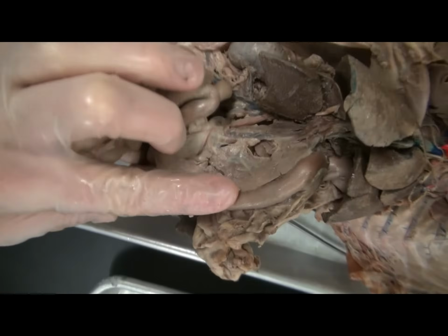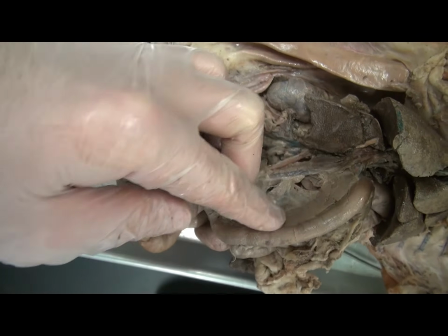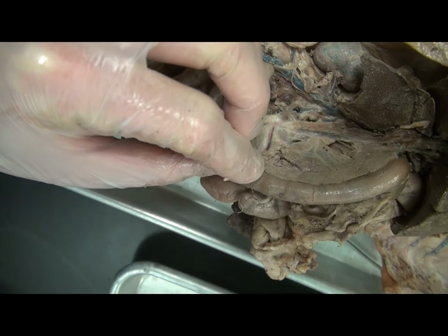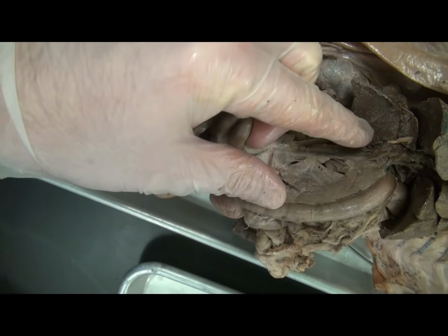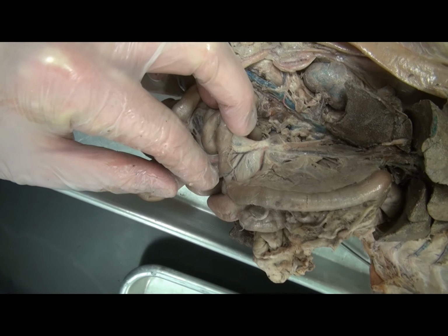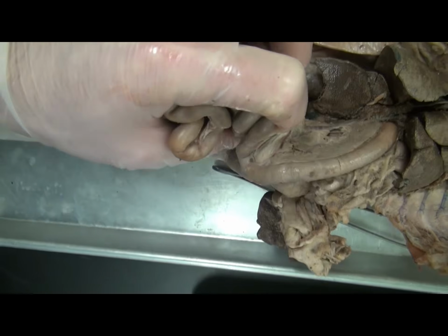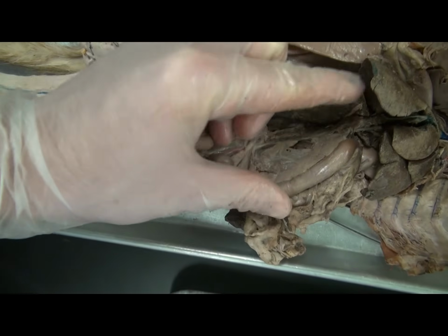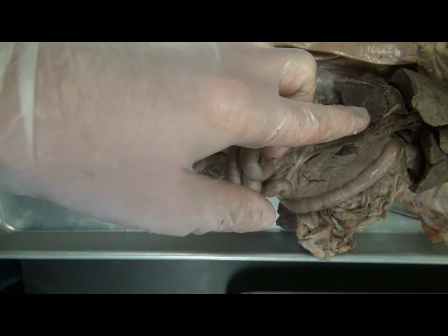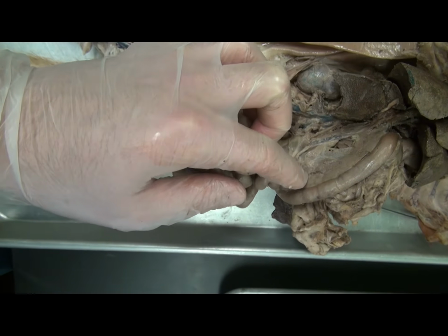Also, the pancreas is an accessory structure. Food does not go through the pancreas, the liver, or the gallbladder, but rather their secretions help with the process of digestion. So here you can see the very thin pancreas as it hugs the small intestine. If you were studying structures to identify, and you were asked to identify something on the right side, you might just make a mental note that this would be an easy place to ask about the pancreas.